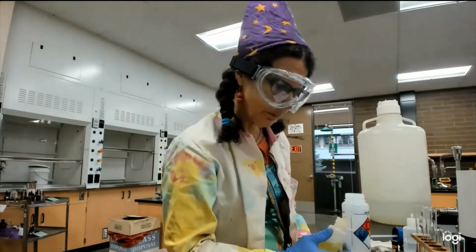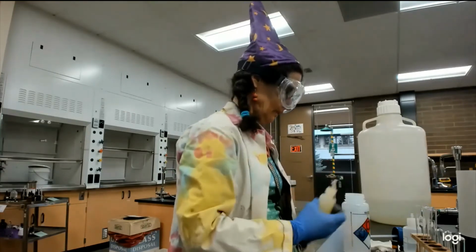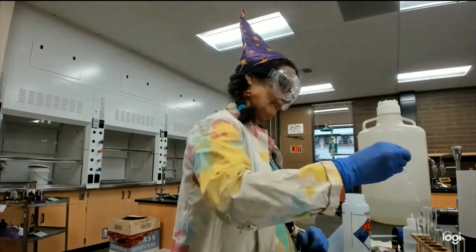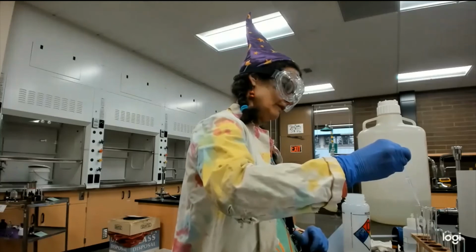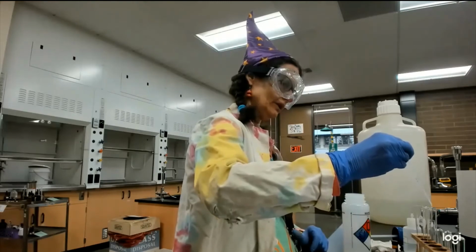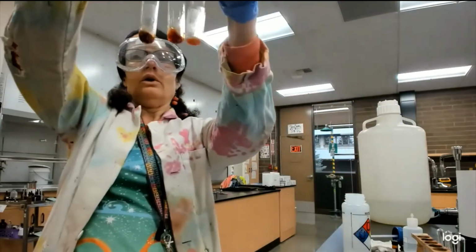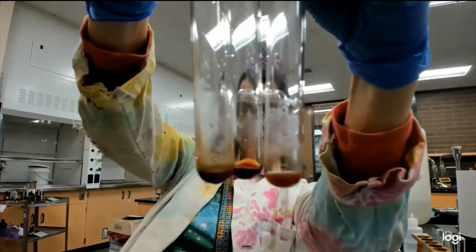All right, what am I adding? 1 drop. This is all just a dream. And then 5 drops water. Oh, we have a winner. Well, I say, let's see.